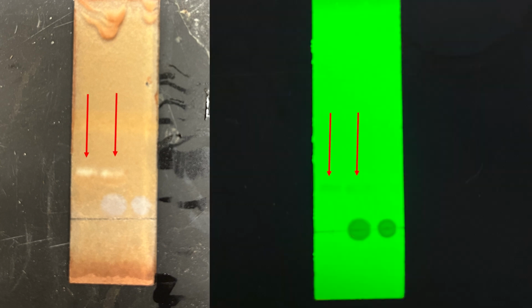And if we look at that in comparison with just the fluorescence, you can see that you get much better contrast when we've used the iodoplatinate. That's generally going to be true. Now, if you don't need it, there's no reason to spray it if you get signal just fine off the fluorescence. But you need to make sure that you have good contrast, obvious data that you don't have to stand there and explain to people. Your report must stand on its own.